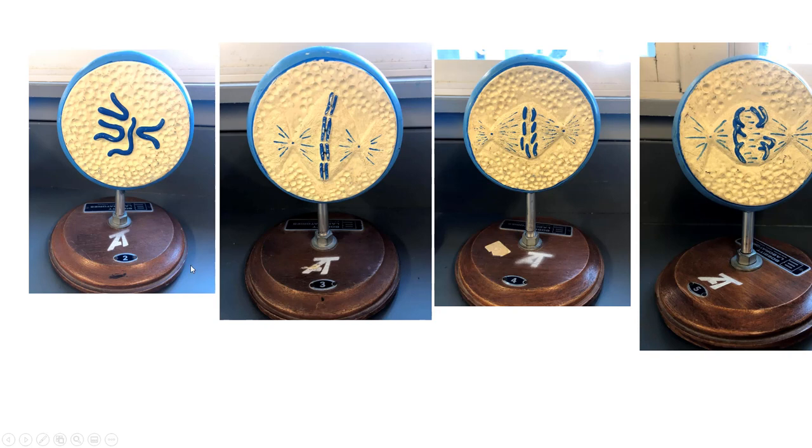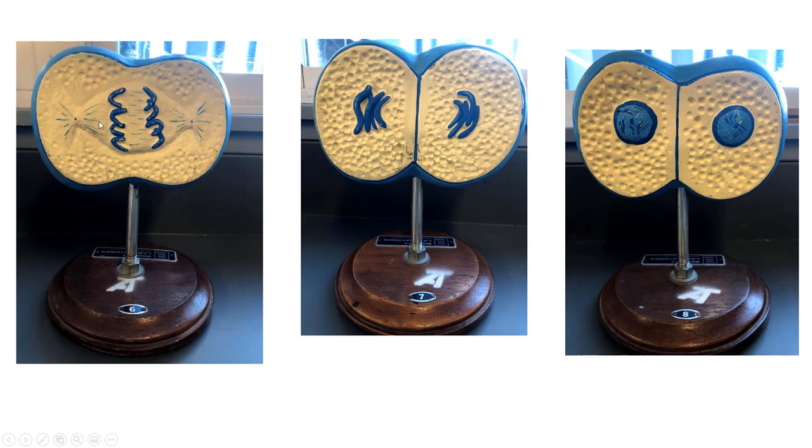Going into mitosis, so the different phases looking at models. So we'd have prophase, metaphase. Then the next several models represent different phases of anaphase. This looks like really early anaphase. This is anaphase kind of midway. And this would be more late anaphase, when the sister chromatids are almost to the end of the cell. And you see the mitotic spindle formed right here. When we start to get the formation of two new cells, it's telophase, and then the official splitting of the cytoplasm would be cytokinesis.